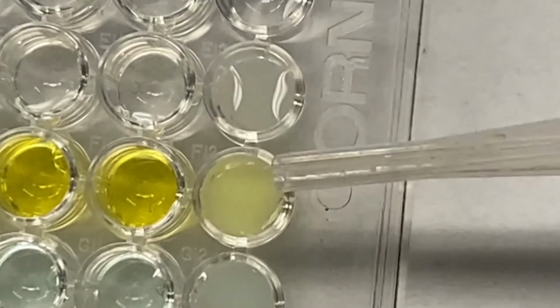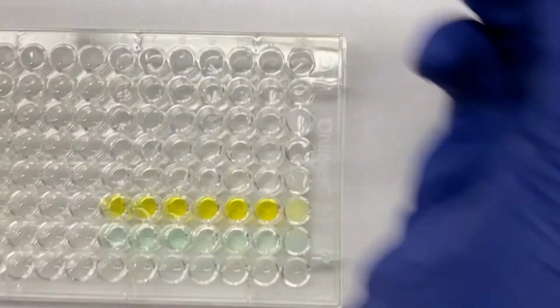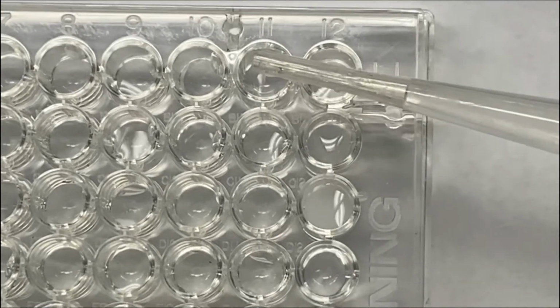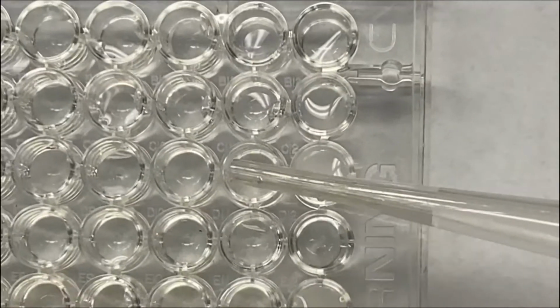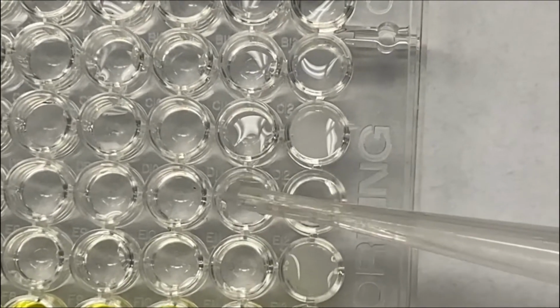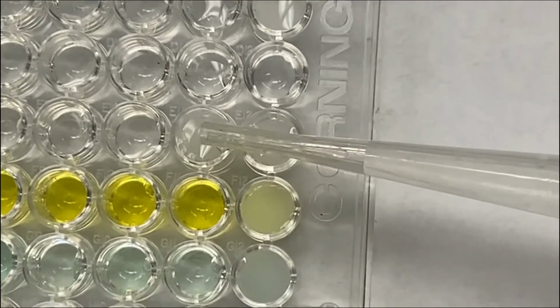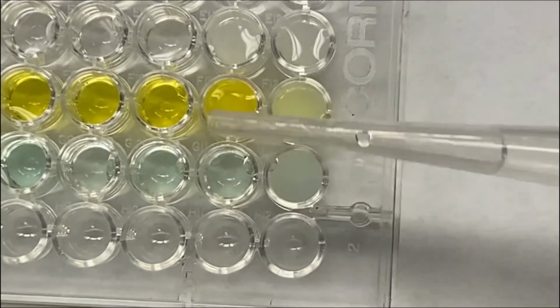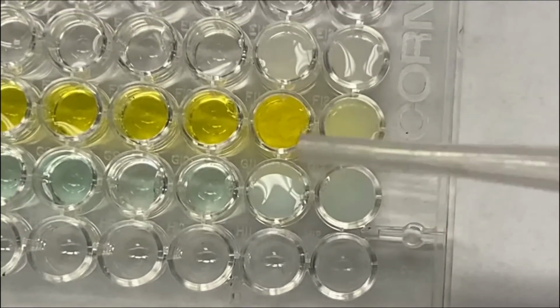This is soluble as well, and there's precipitate and precipitate here. Adding my Pb(NO3)2 to A11 to G11. 2 drops as well. 1, 2. Okay, it's also clear. Nothing's happening. Nothing is happening to this as well. Okay. Oh, I see a precipitate here. Okay, there's a precipitate here as well. There's a precipitate here as well.